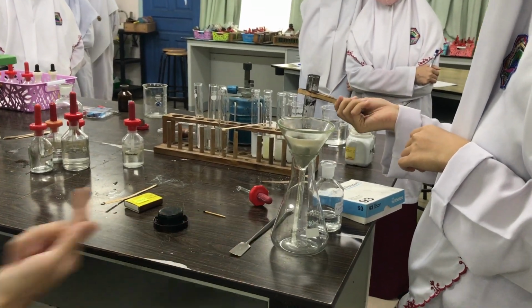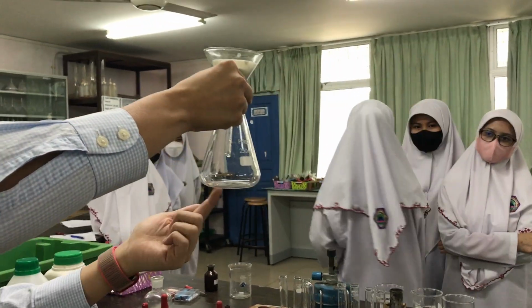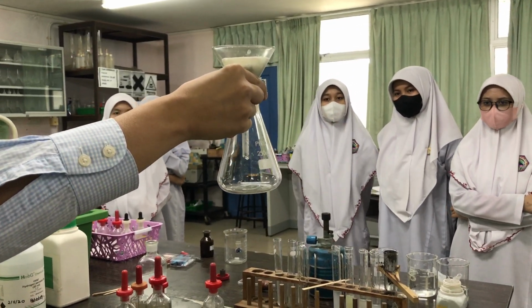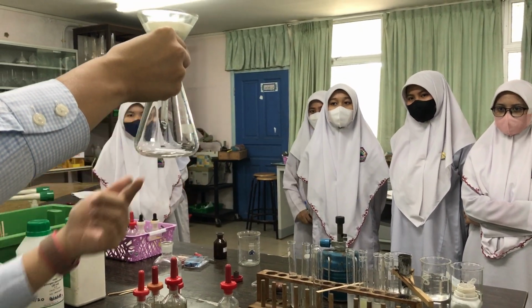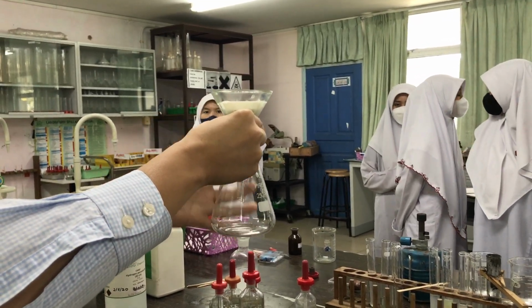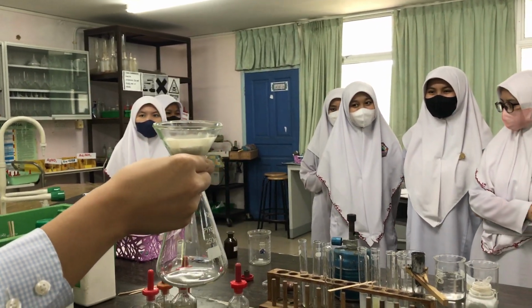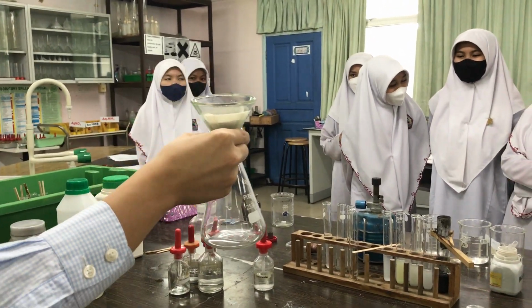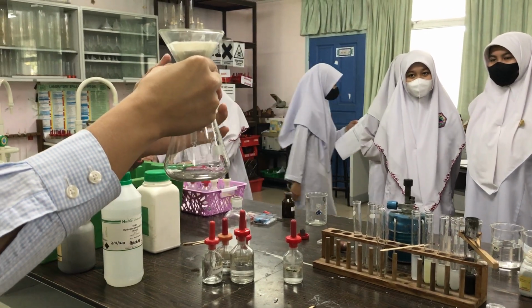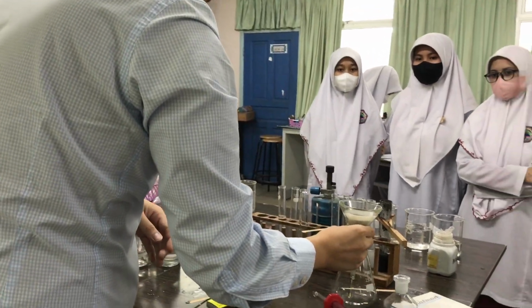Do you see the clear liquid coming through? What color is the liquid coming through? So what do you call the liquid that is coming through? I know there's a special name for it. Describe the solution that comes through in the filtration technique. Residue is the solid that's left behind. What is the liquid that passed through? Solvent? No, it's no longer called solvent. It's called filtrate. Was this in year 9? Filtrate, the solution that passed through. Residue, the solid that's left behind. Year 9 separation technique. Okay.